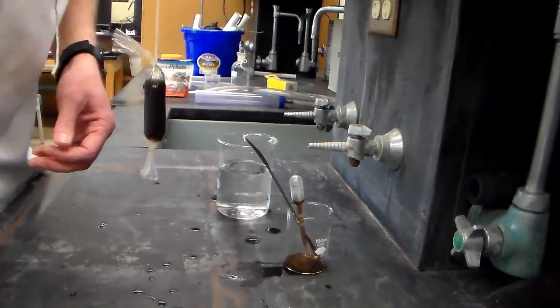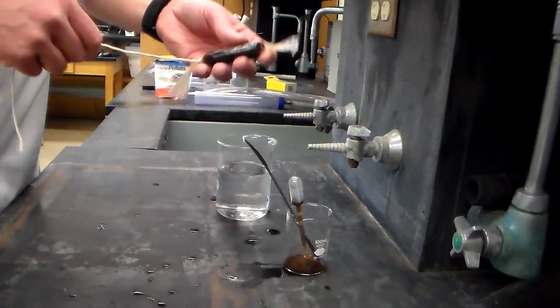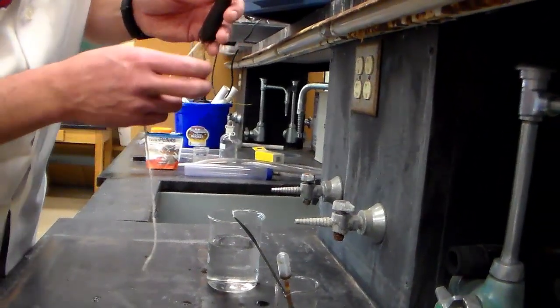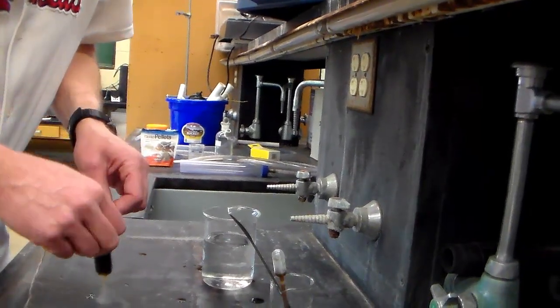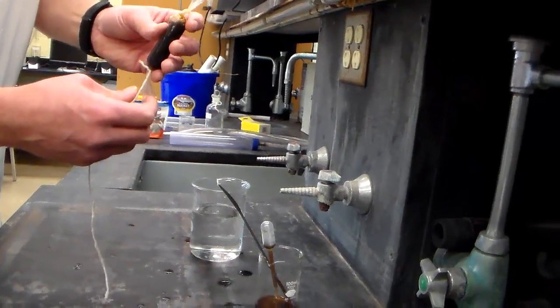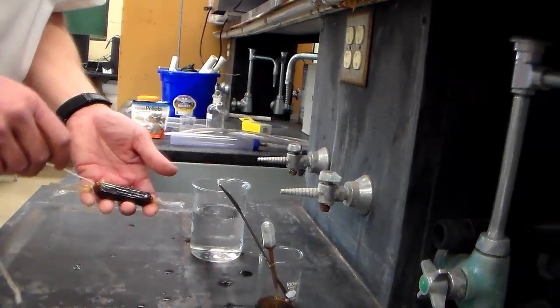So now we've got the molasses in the tube. Kind of flip it back and forth and it looks like it's sealed very well. The ends need to be sealed tight so that molasses doesn't leak out. This looks really good.